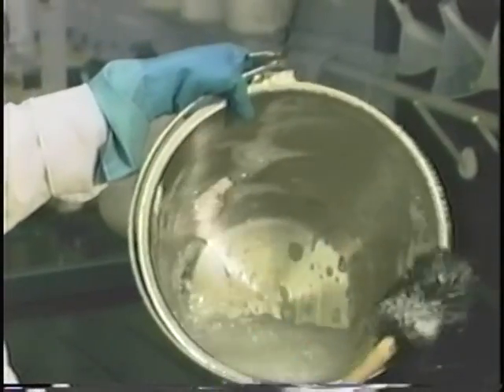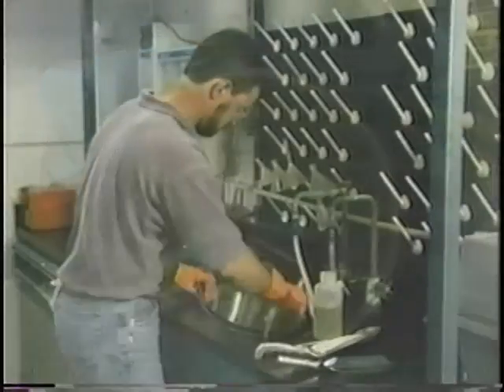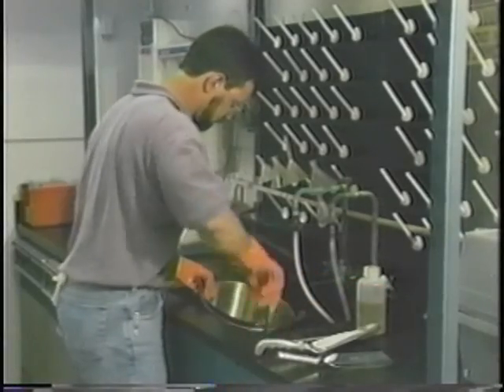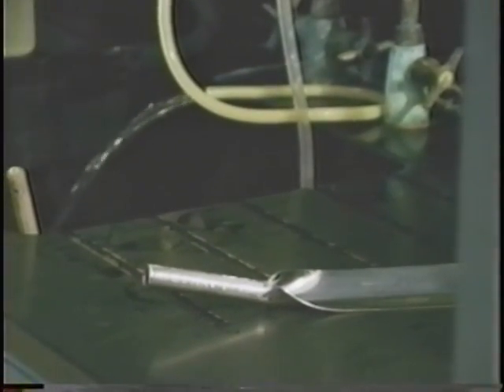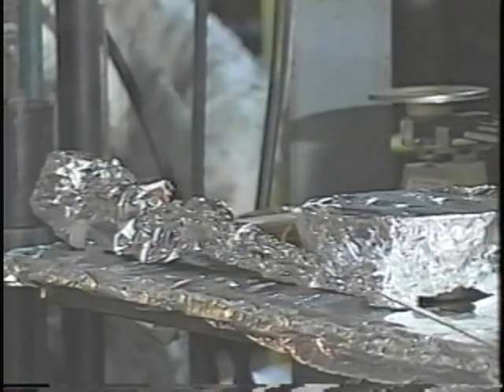To wash sampling equipment, do the following. Wash with laboratory-grade detergent and water. Rinse with tap water. Rinse with a 10% acid wash. Rinse with deionized water. Rinse with an organic solvent like hexane if you do not have time to allow the equipment to air dry, and cover the equipment with foil to prevent contamination.